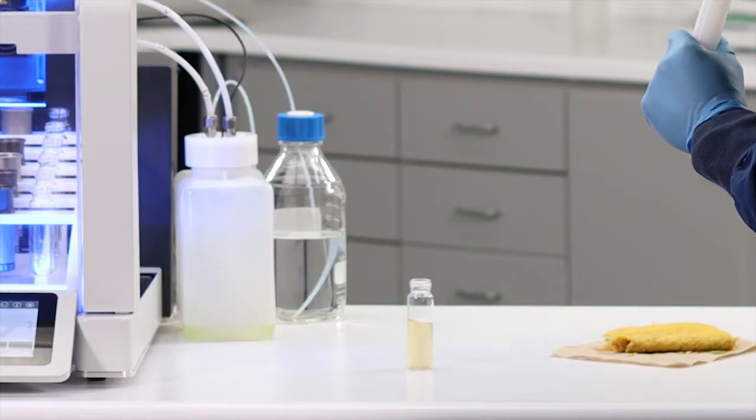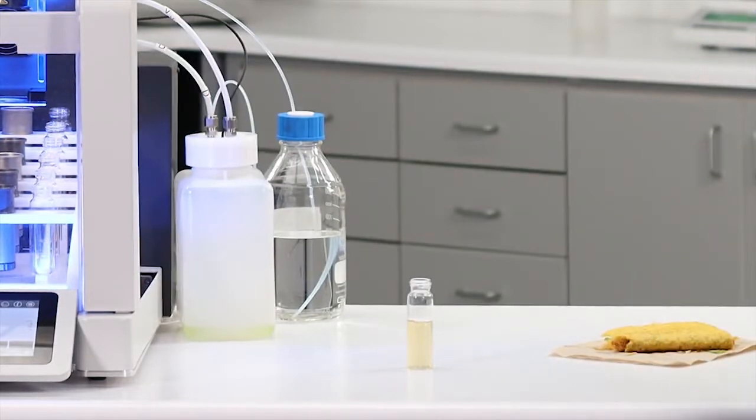You've done it again: a nice, clean, filtered, clear extract ready to go straight to analysis.